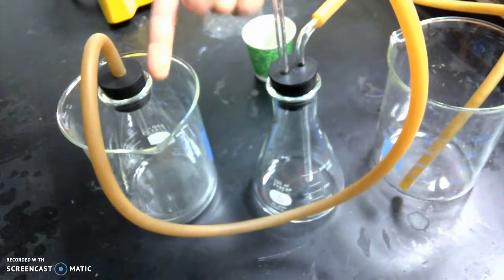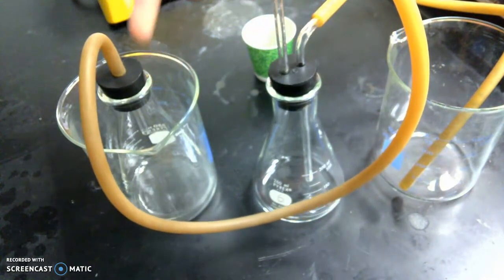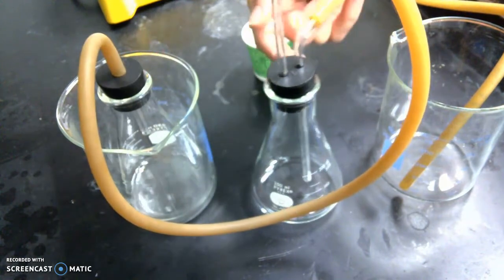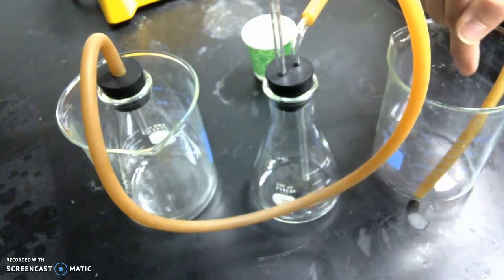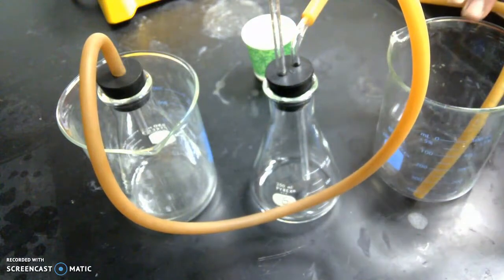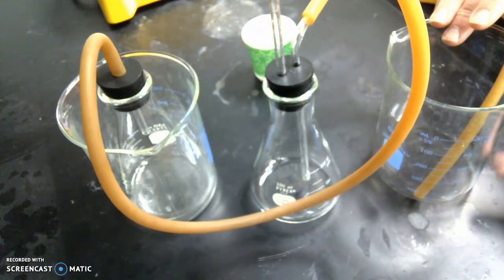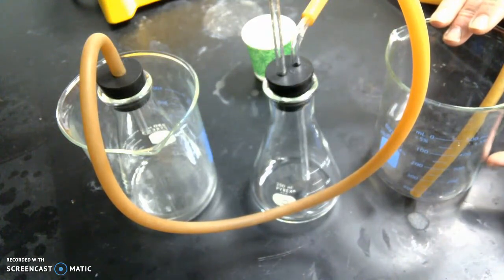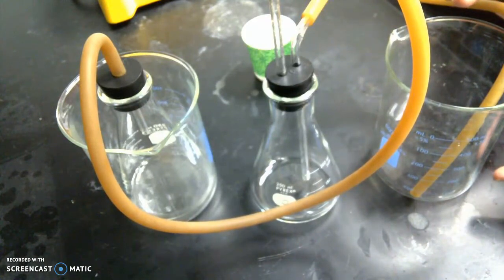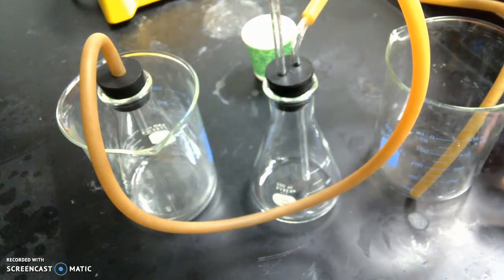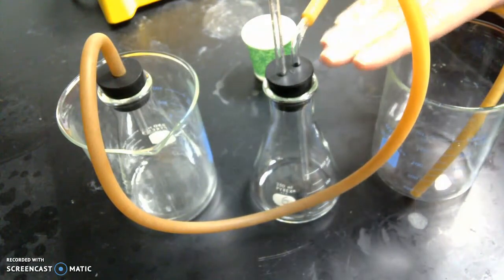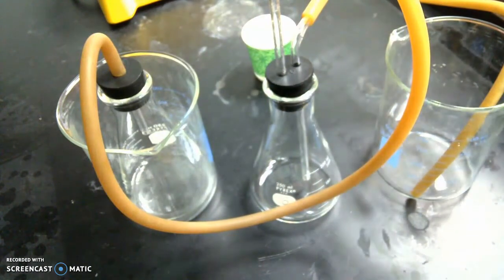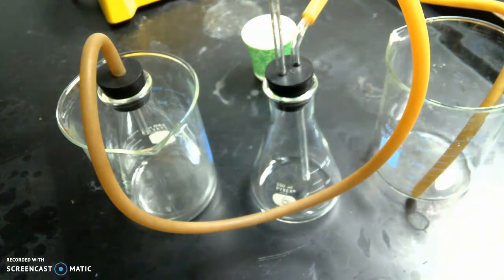You're then going to watch that as you have a production of gas, which in this case is CO2 being produced. The gas is causing the water to displace into the beaker, the displacement beaker. By measuring the water amount in this beaker using a graduated cylinder for accuracy, you're able to then calculate how much or figure out how much gas is being released because this is a closed system, and you'll be performing this lab on Thursday.